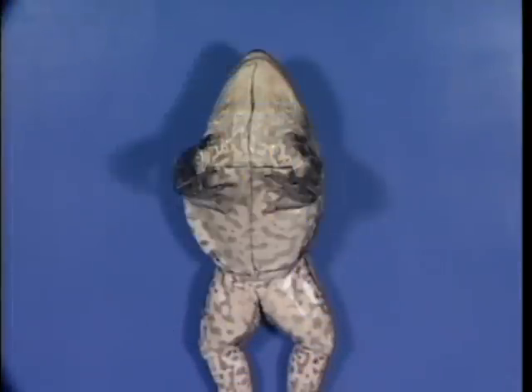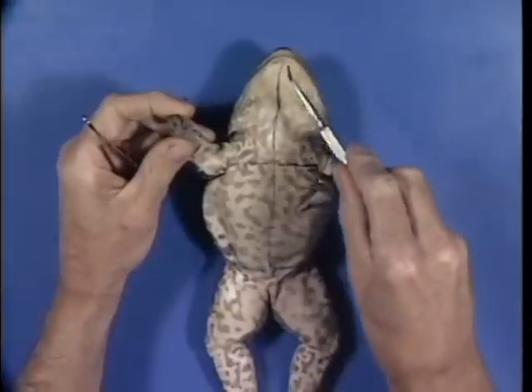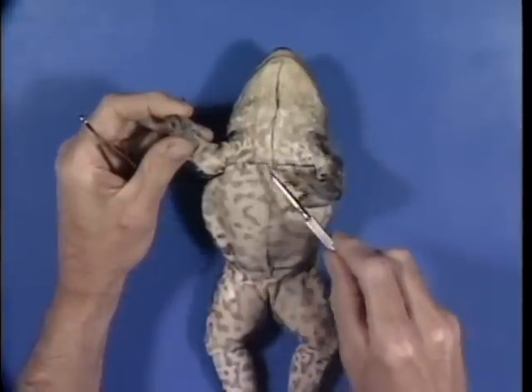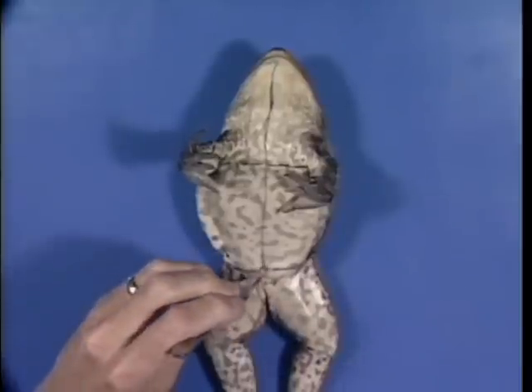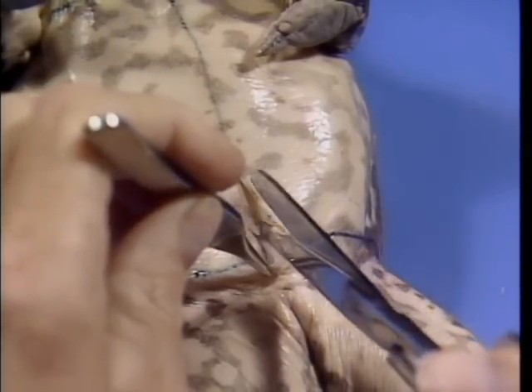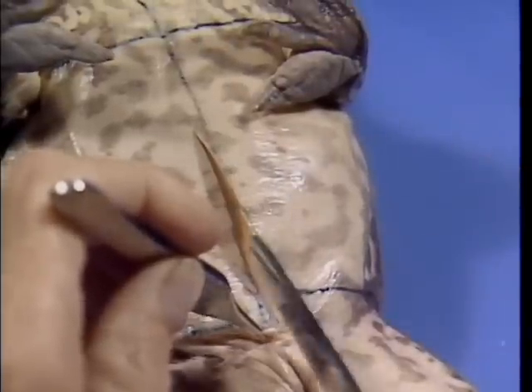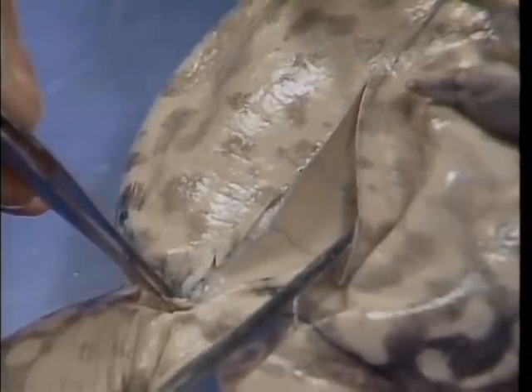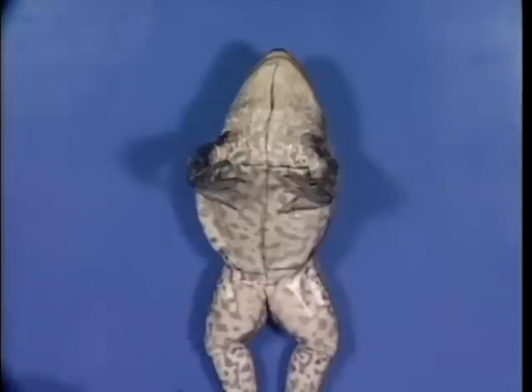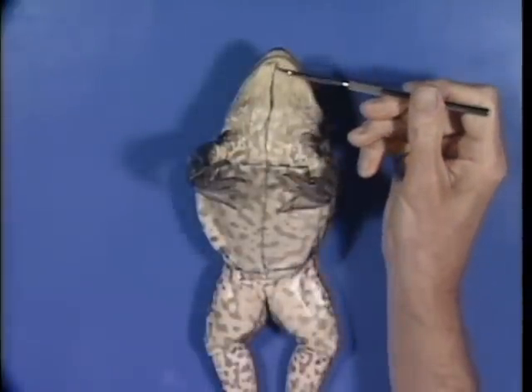In order to examine the ventral muscles of the frog, it will be necessary to make incisions along the lines drawn as shown here. Use forceps to grasp the skin up at a point just anterior to the cloacal opening and make a small cut with sharp scissors or a scalpel through the skin. Be careful at this point not to cut so deeply as to enter the abdominal muscle layers beneath the skin. Then extend the incision anteriorly until it reaches the junction of the lower jaws.